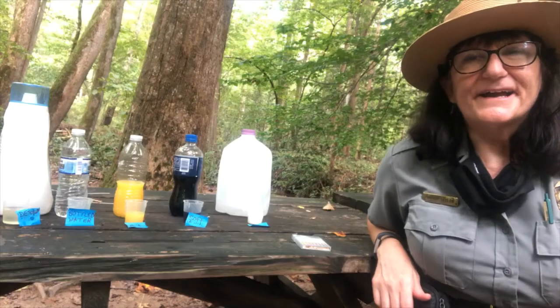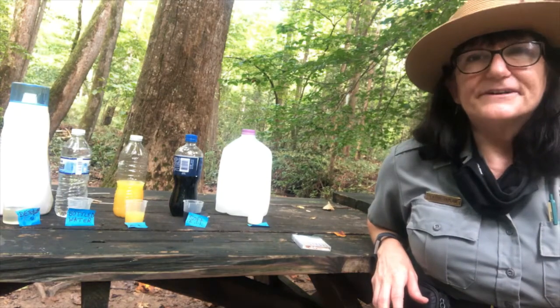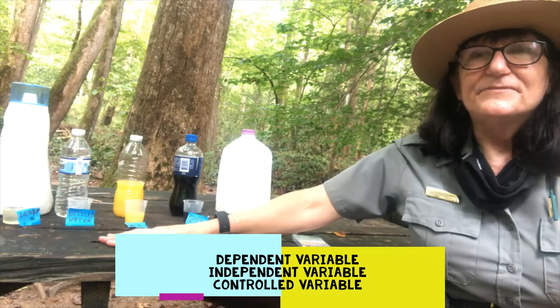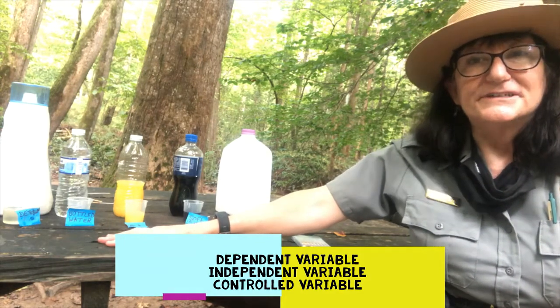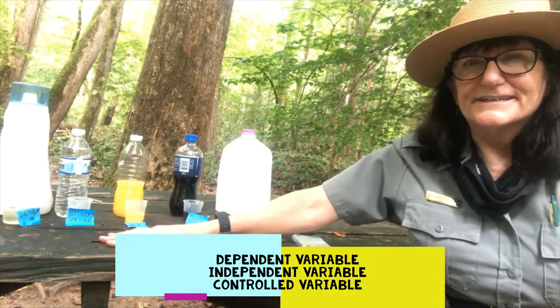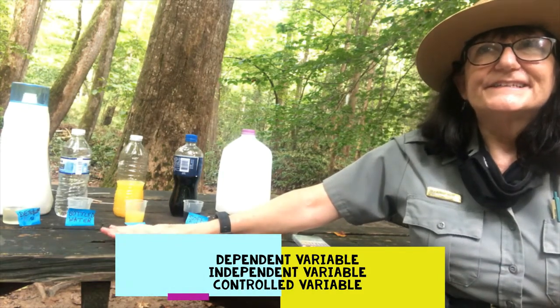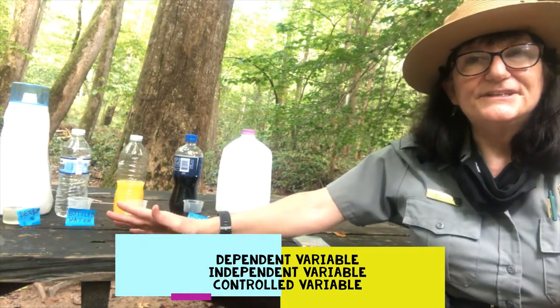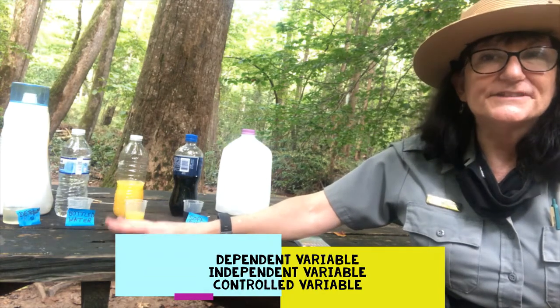So let's think a little more about this experiment we're doing here with pH. We have variables, and so we can say we have dependent and independent variables as well as controlled variables. That's talking like a scientist. And we know that the pH is dependent on which liquid we use. So it's the dependent variable. It depends on which liquid.